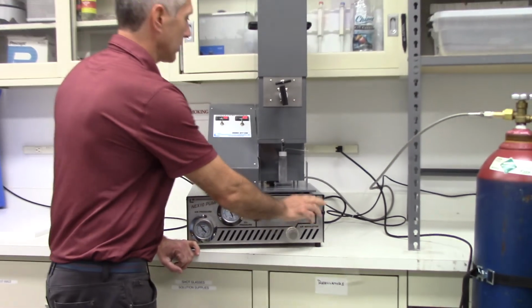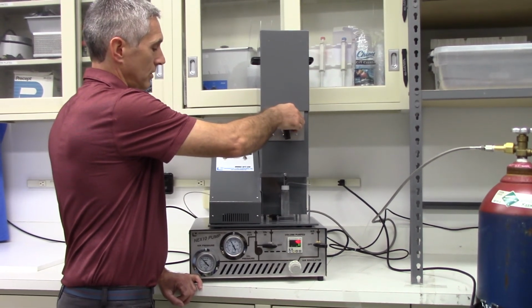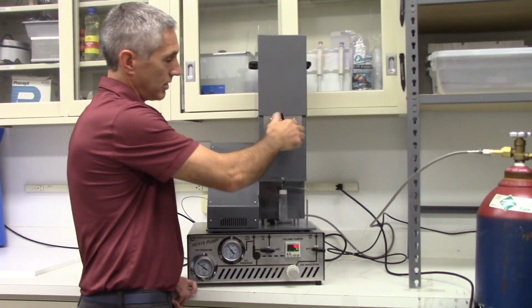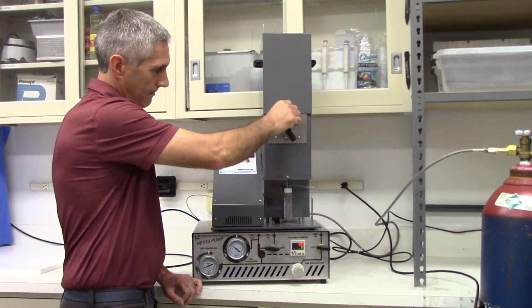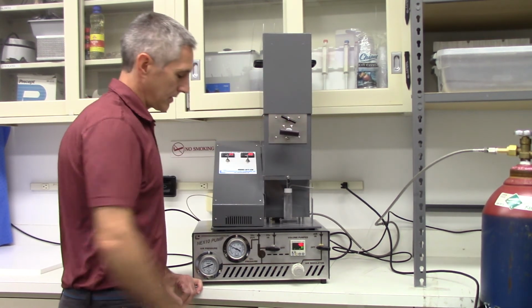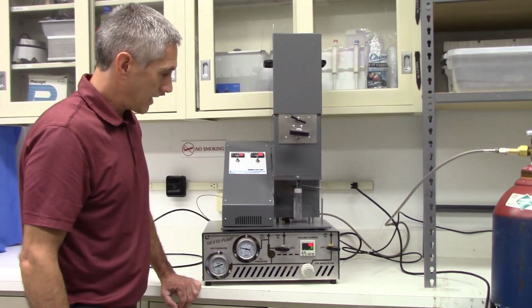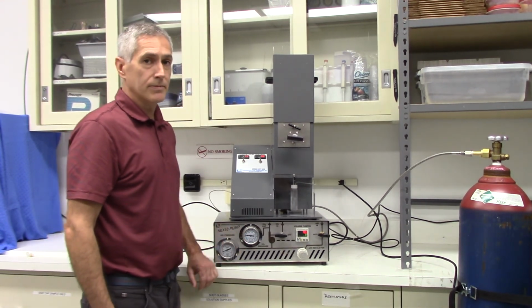once all these valves are closed, to vent the system, we're going to vent through your sample. Again, your sample should be vented out to the hood or a safe location. Open that all the way up. Start your flow, your pressure's coming down, and then it's just a matter of waiting till your gauge says 0 before you can check your sample.